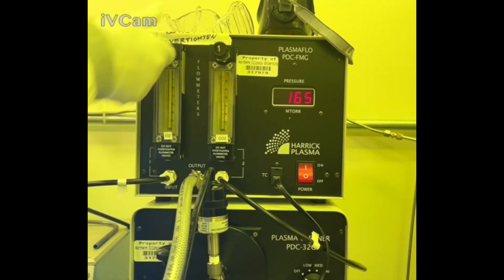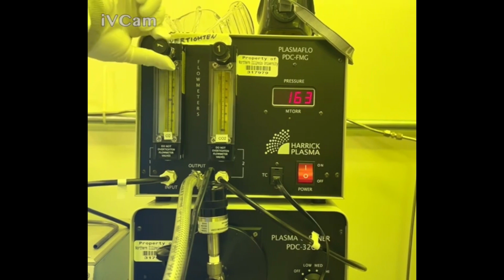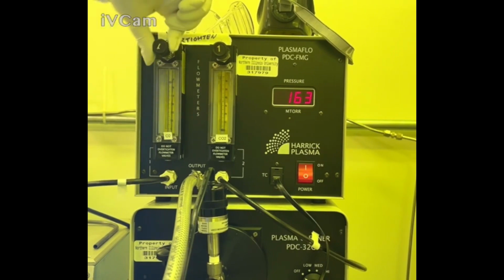So I'm going to watch this little sphere move from the bottom all the way to the top to its maximum value. Once it's there, I'm going to set a timer for 2 minutes and just let it sit. So one thing I did want to point out in the video before it gets to the next section, in prepping the video to show you the tanks and how to open them and where they are, I didn't realize that I never had reopened the tanks before the start of the video.